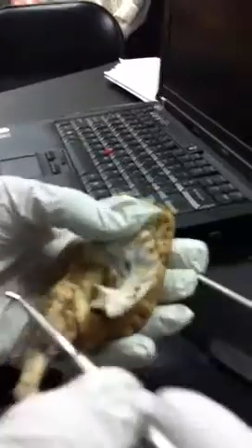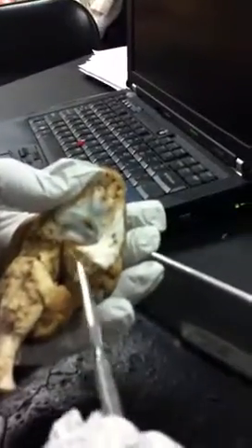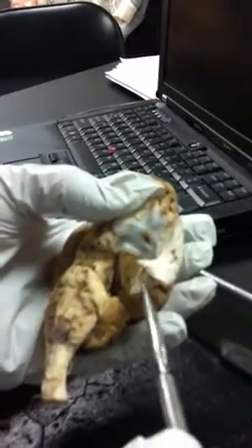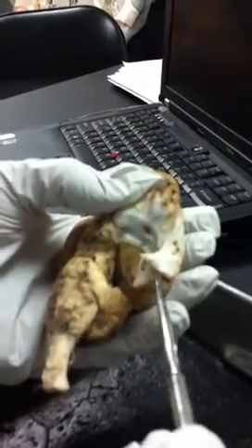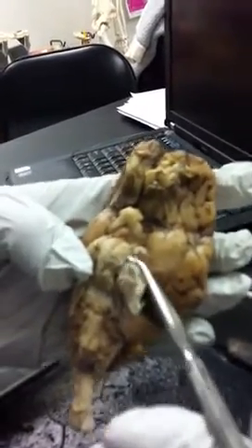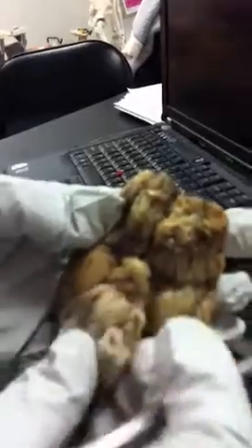All right. So that's on the ventral part. This was here. These were part of the trigeminal. This is the dura mater. And this was like this. And this would be the pituitary gland. And the infundibulum would have been like under there.